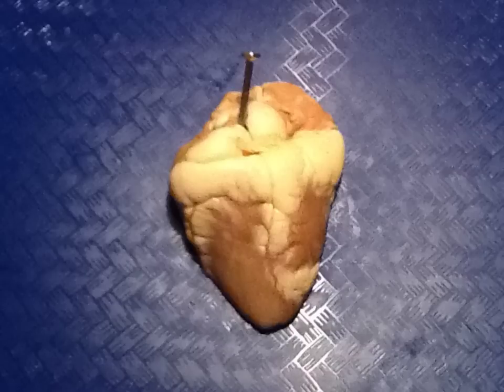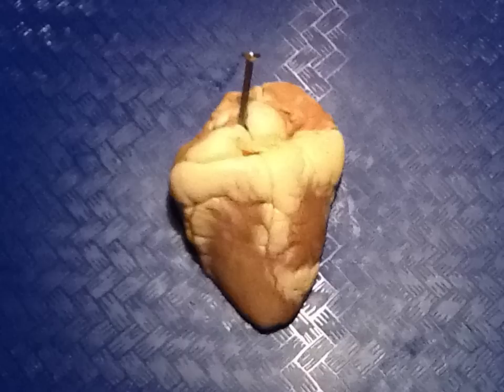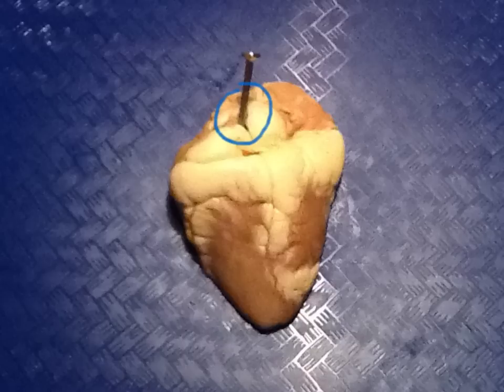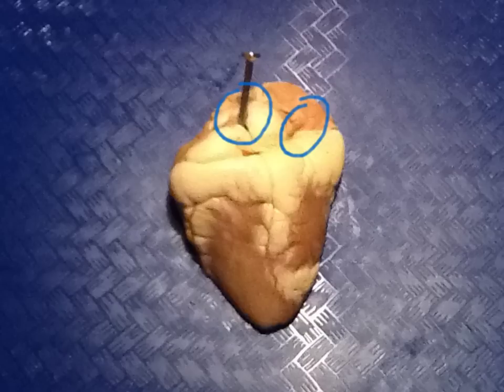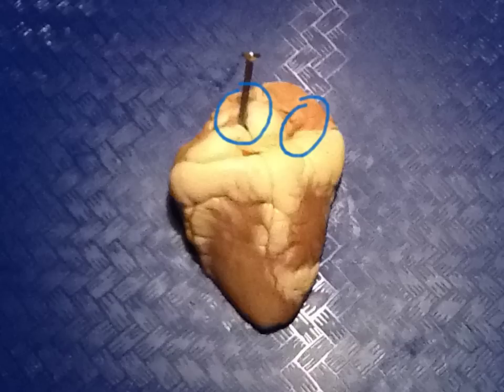In this view of the heart, we see the two other major blood vessels. We see the vena cava and the pulmonary veins. The vena cava is the blood vessel through which blood travels back to the heart from the body. The pulmonary veins are where blood flows from the lungs.